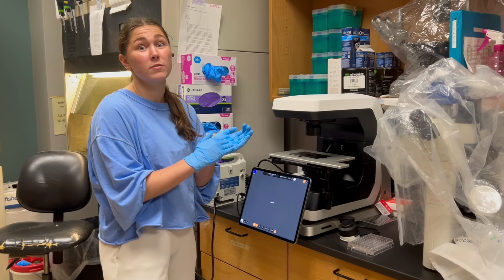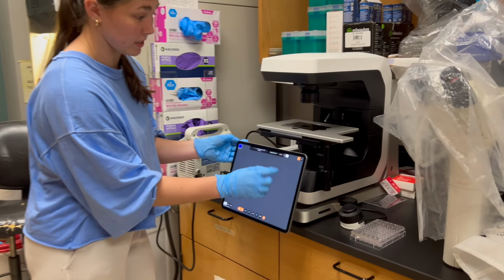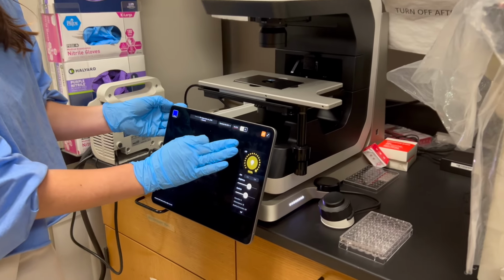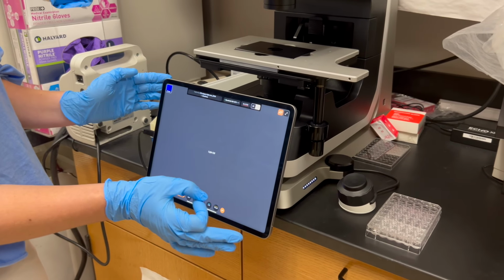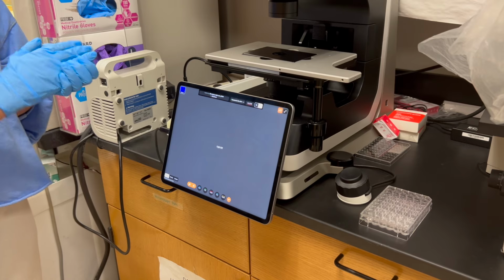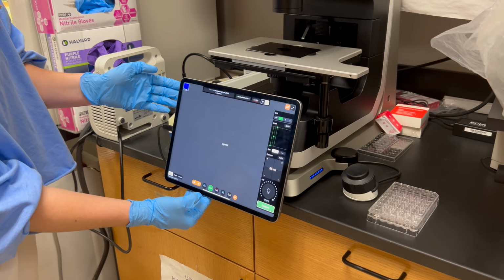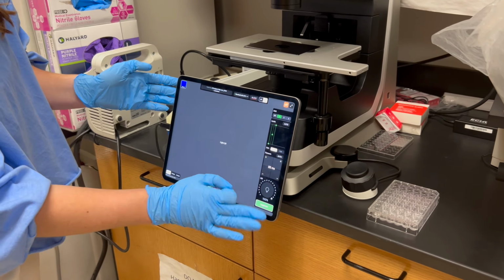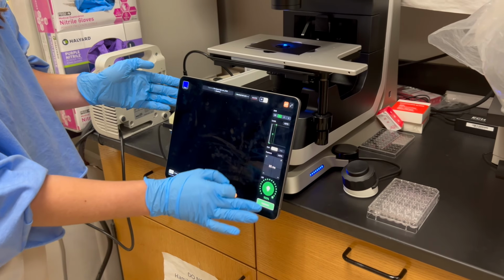We are also going to be viewing in fluorescence imaging today. So what you're going to do is take this microscope and on the app switch from bright field, which is this white light, to fluorescence imaging. We recommend that you view your live cells in the FITC filter, which comes across right here. You'll be able to control the amount of light coming through as well as the exposure on these 2 tabs.